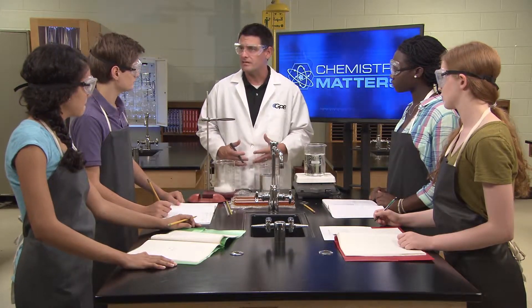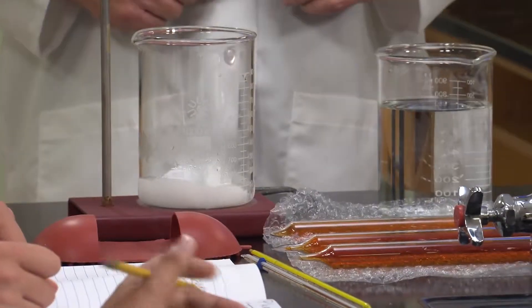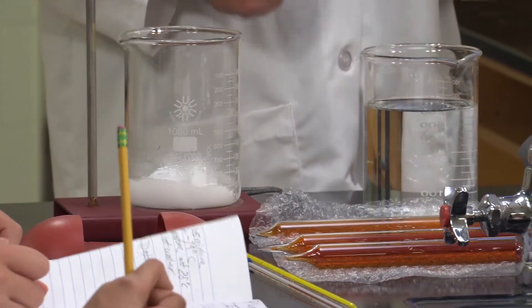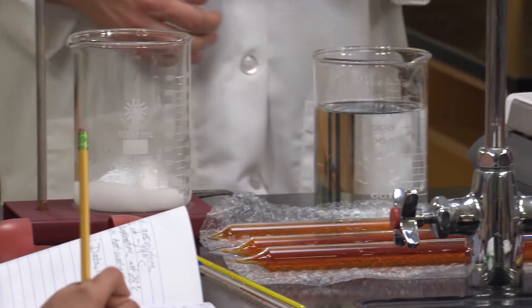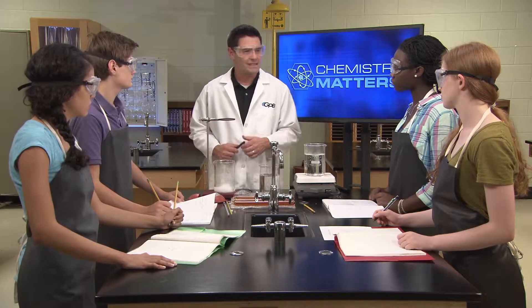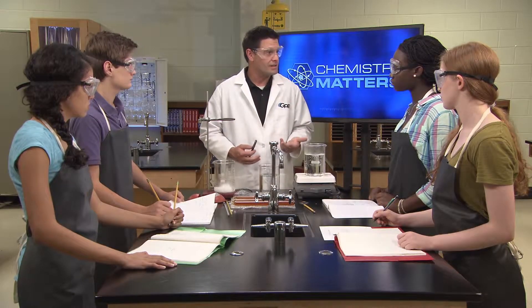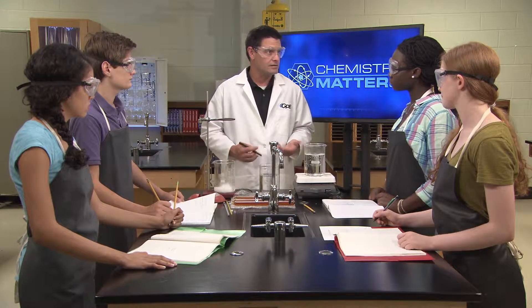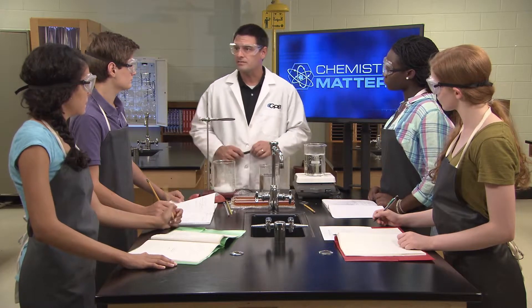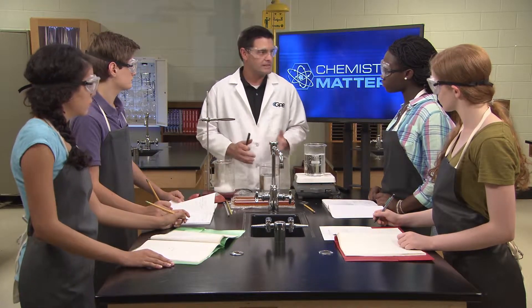This sounds like both of you are off to a great start. Let's get our materials together and get started with the investigations. The gas tubes, the thermometers, the hot plates, and the ice are all available for you in the lab. Let me know if there are any other materials or supplies that you need. Record careful observations and organize your data into a data table.